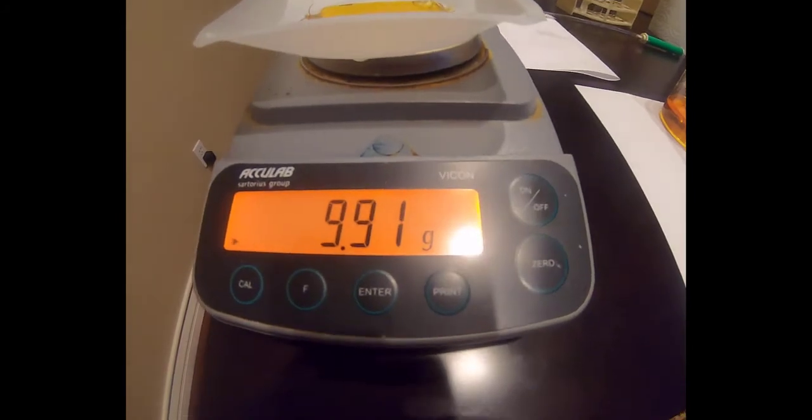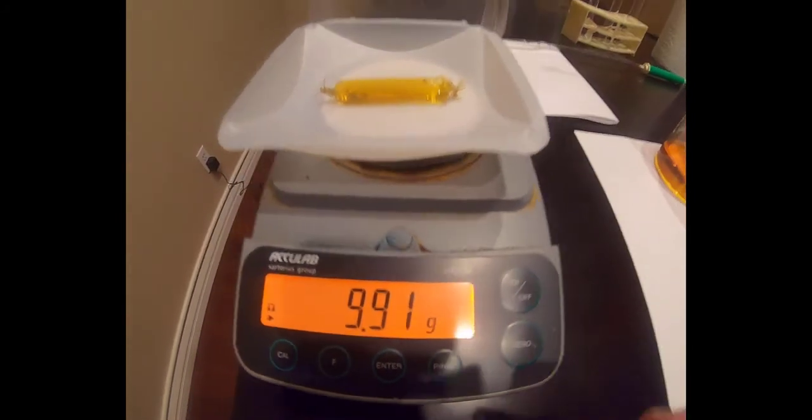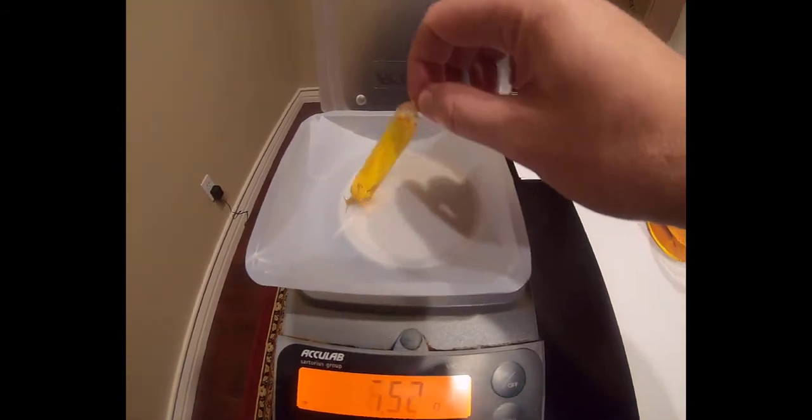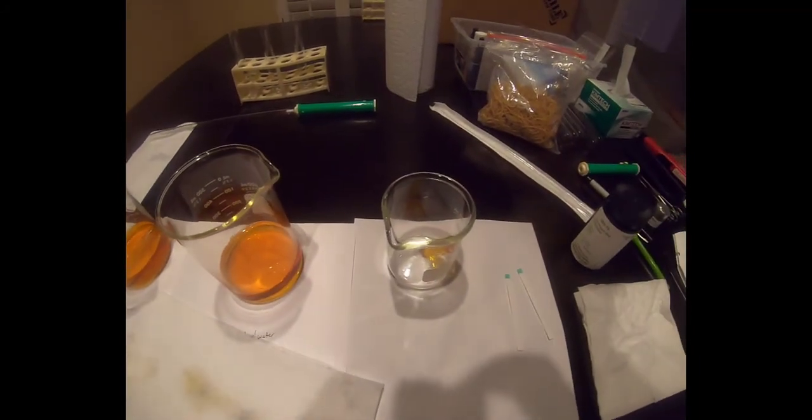Here you can see the final bag weight is 9.91 grams. So the bag lost 0.08 grams in 75 minutes. This is a very small amount of weight, which is within our margin of error for weighing. So we would consider the bag start and end weight to be nearly identical. This indicates that no osmosis has occurred into or out of the control bag, which is what we expected.